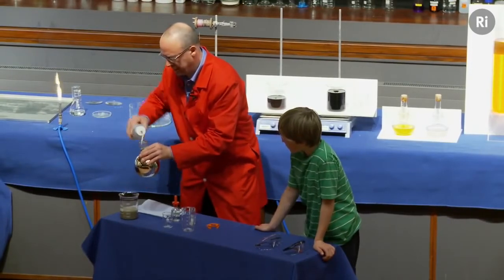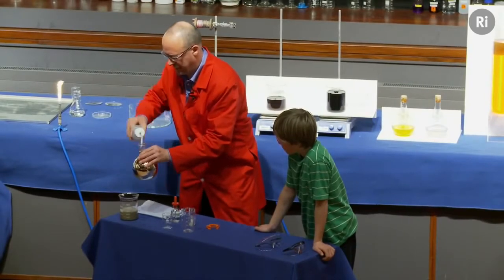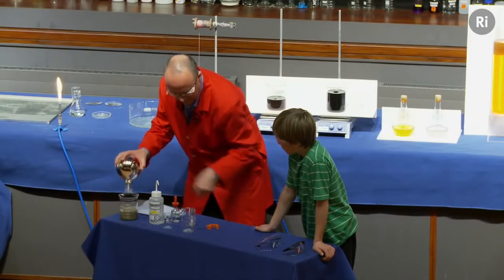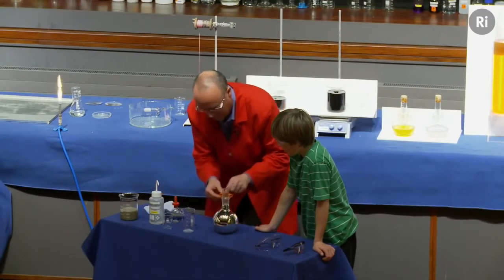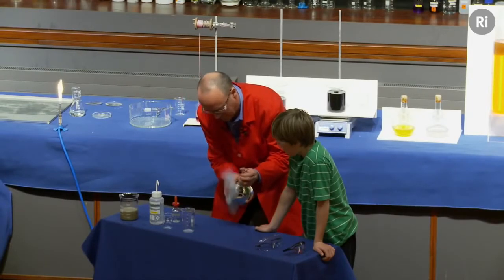I'm going to rinse it out a second time. Rinse it out a third time. There we go. And just going to put that on, just dry this off. And put the clip back on. And if you'd like to just give that a little polish, there we go.